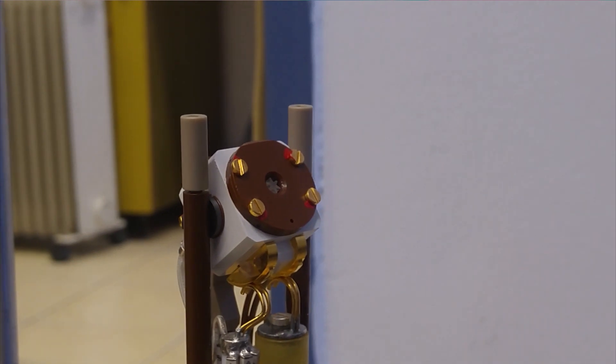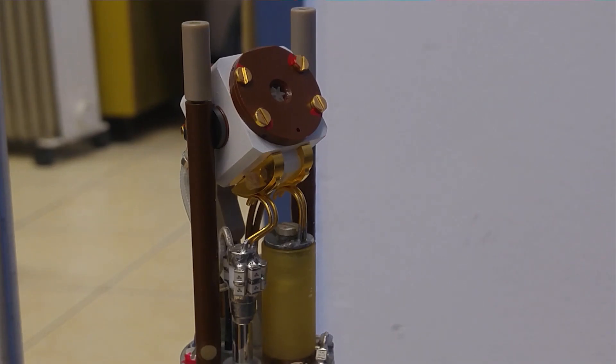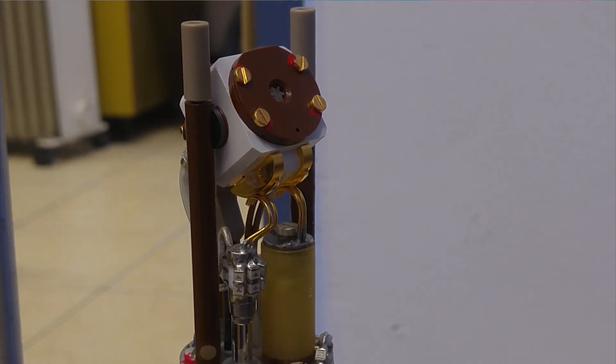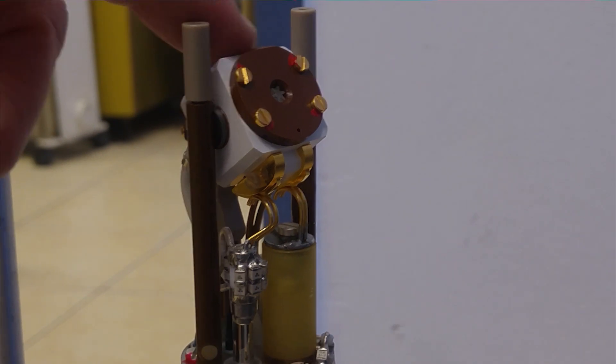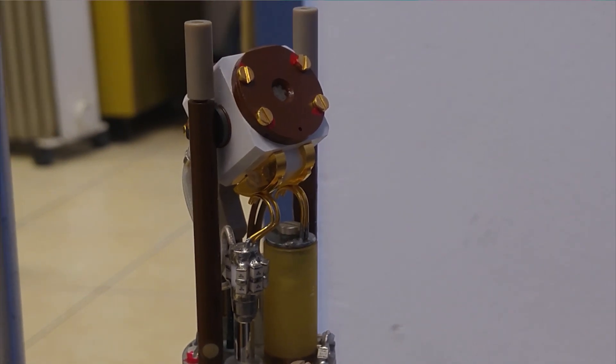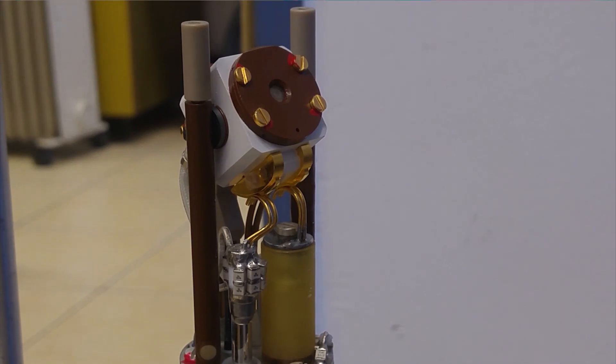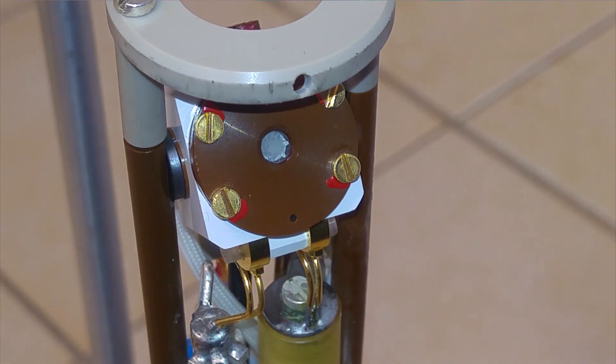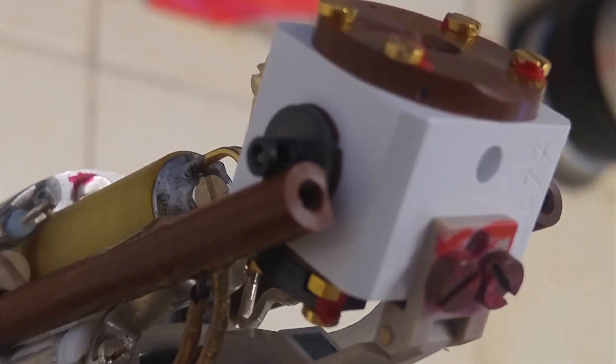Let's try again. Now it's going to spin. The spin rate was not sufficient. It only span a few tens of hertz, so you can still see the spinning in the video here. So, we had to do something. I think I have an answer.